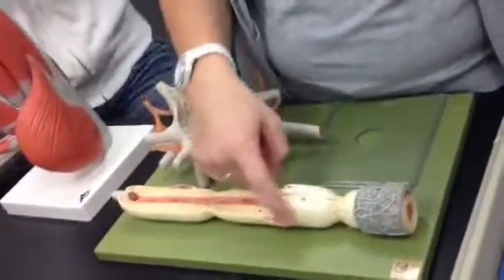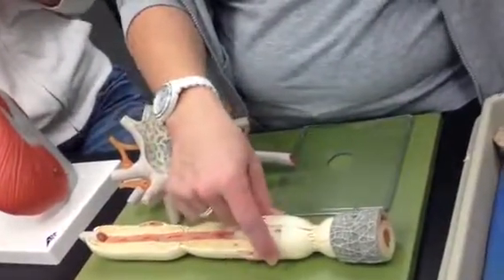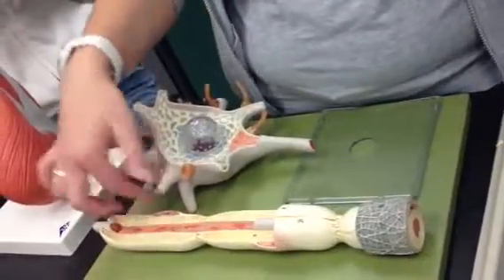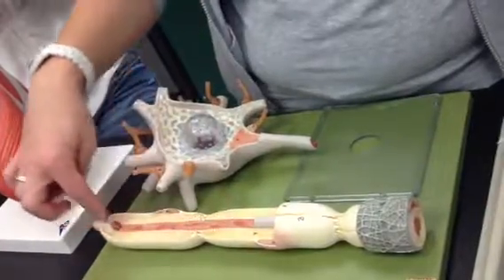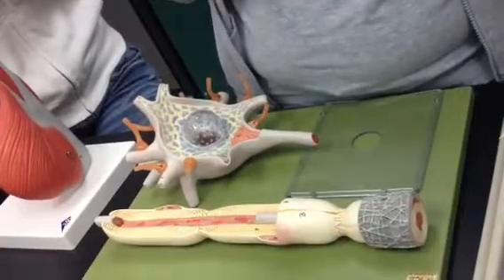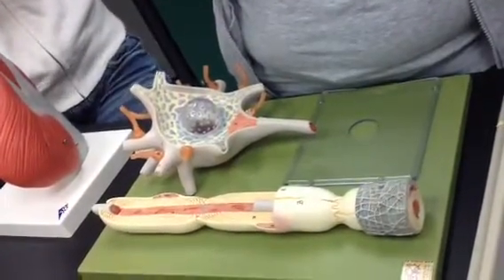And then here is this little bump here. What's that bump called? I just went over it. The nucleus. Or the neurolemma? Yep, exactly, neurolemma. And that's where the nucleus is and the little bulge of cytoplasm and everything. So what is this thing in the middle? The axon. That's the axon, right. So at the end of the axon, it terminates. What are those called? Axon terminals, right.